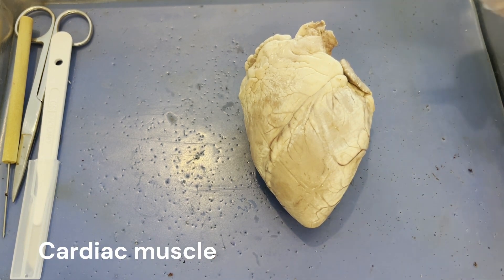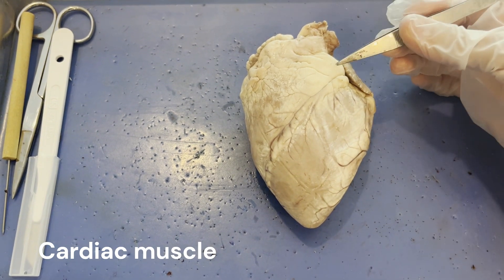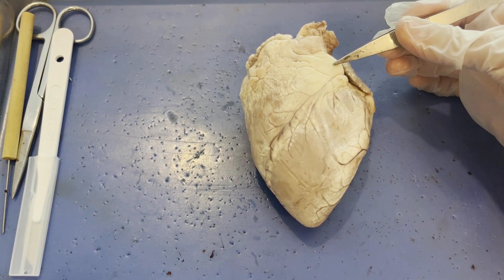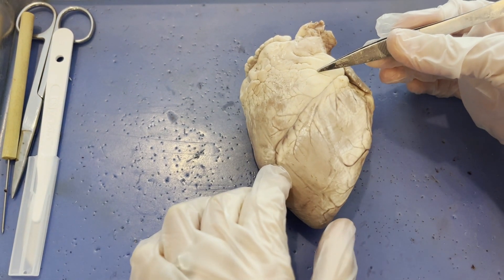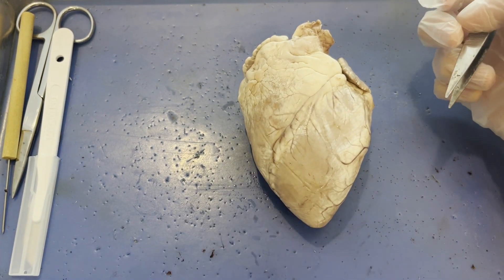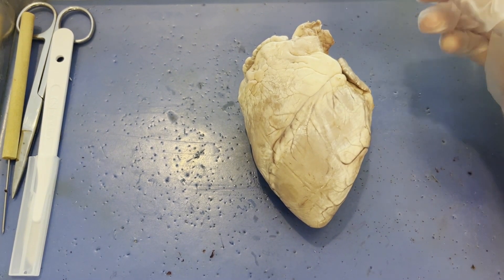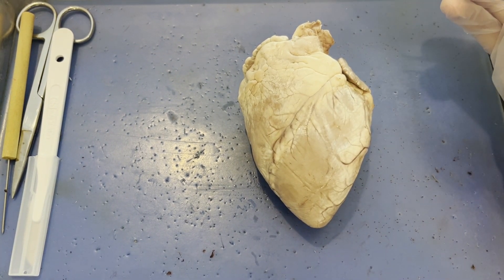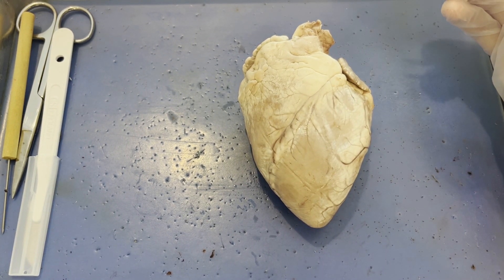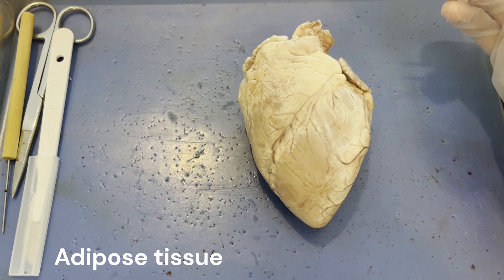The other major tissue you're going to see on the heart is this white blobby tissue up here. This is fat tissue, which is more scientifically called adipose tissue.